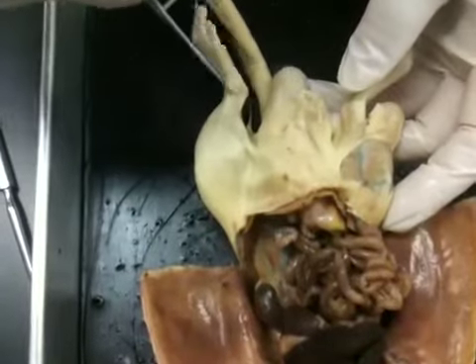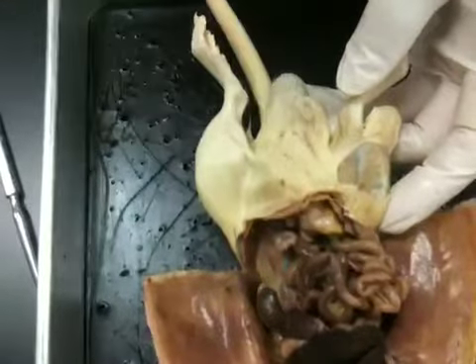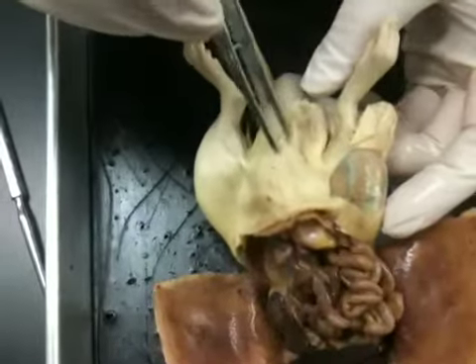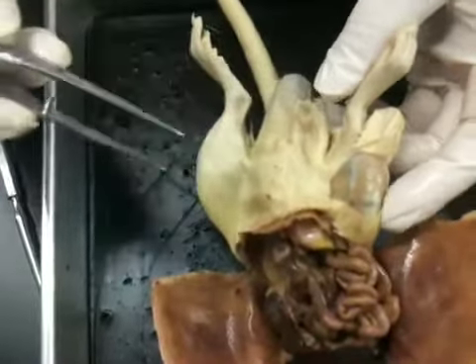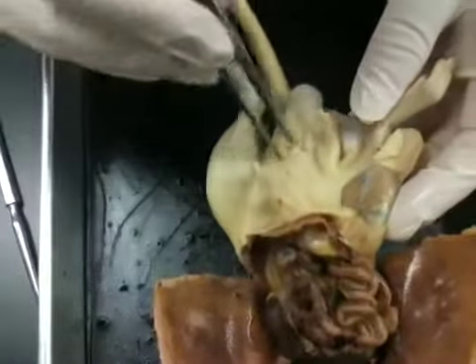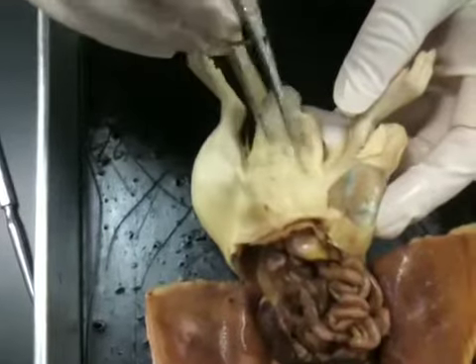If you have a male child and this occurs, they'll simply go in and release that tendon, and the testes will drop. So here we can see, and according to Mrs. Arterberry, none of the other male rats will make fun of him. Don't worry, it's okay. So here we can see where the urethra is coming out.